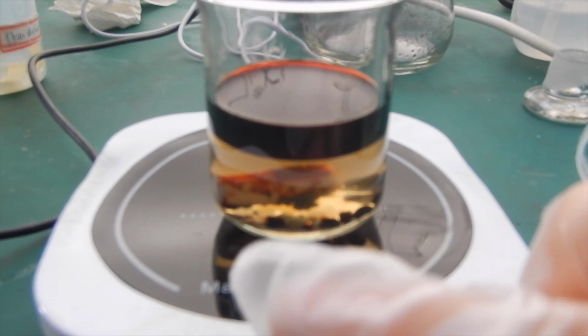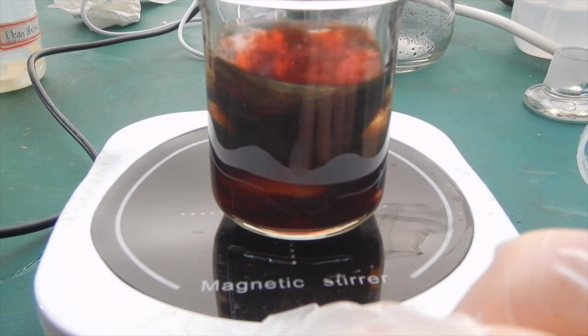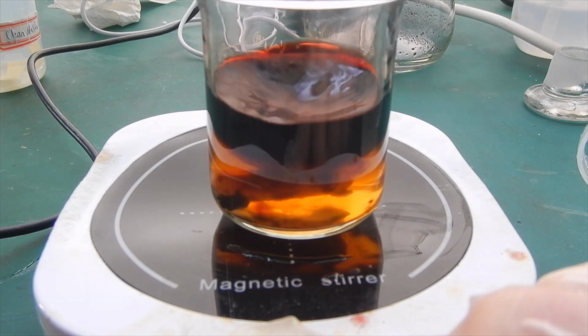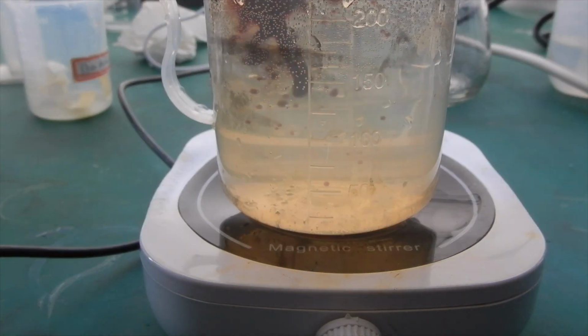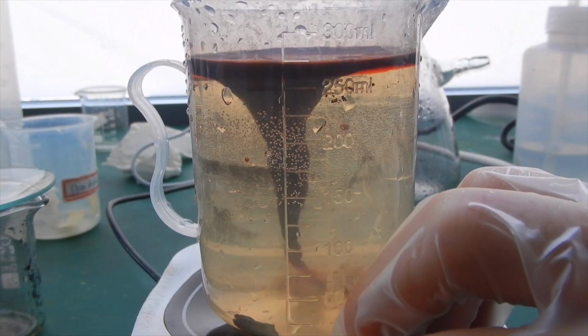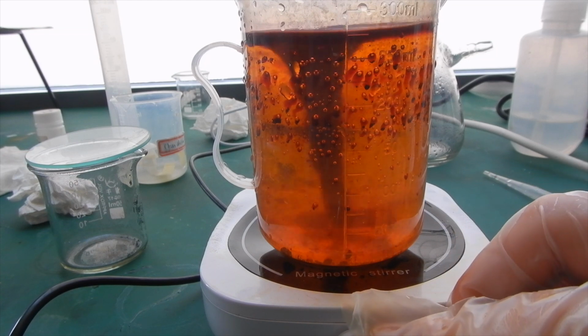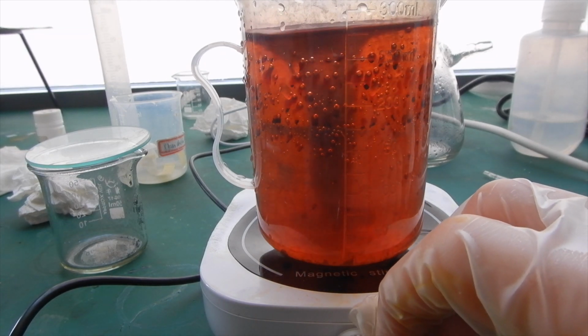The mixture is then moved to a small beaker, and I stirred the solution vigorously to transfer all the iodine to the ether. After the extraction, the ether layer was completely dark and opaque. All the contents of the small beaker are then poured into the large beaker, and I stirred everything again to let it react. A while later, the color of the iodine did not completely fade, but I am running out of time, so I proceeded to the next step.